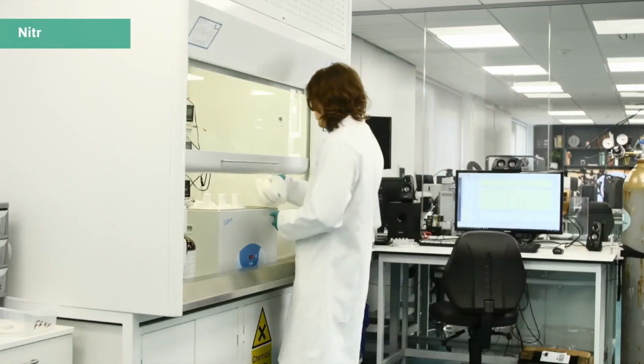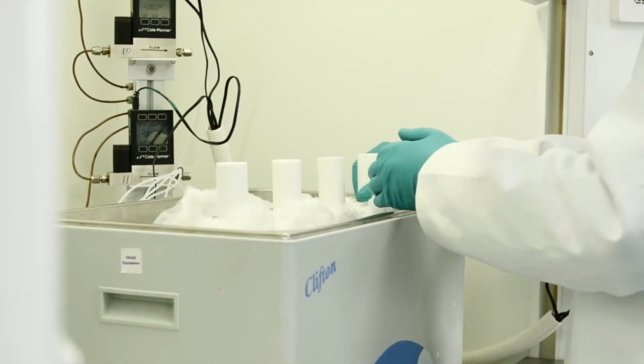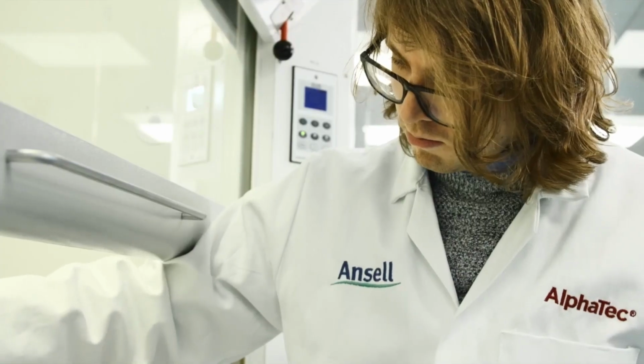The main difference here is, instead of using an FID detector, flame ionization, where it will burn up the sample, we're using a mass spectrometer. This not only allows us to detect how much of a chemical is permeated, but also allows us to capture key information about that chemical, such as fragmentation patterns, just to let us know exactly what has permeated.